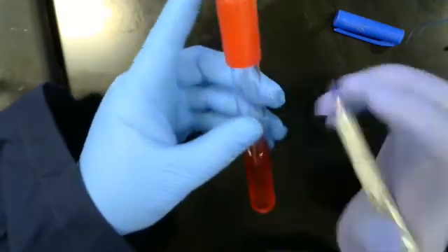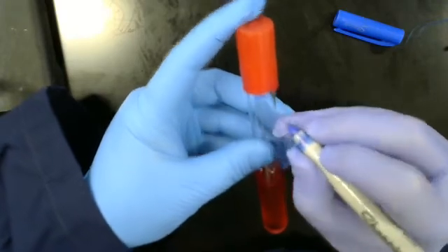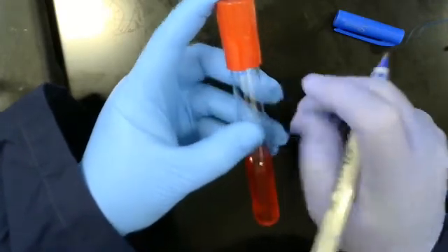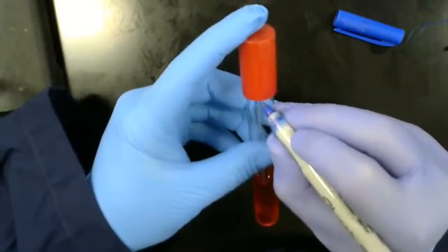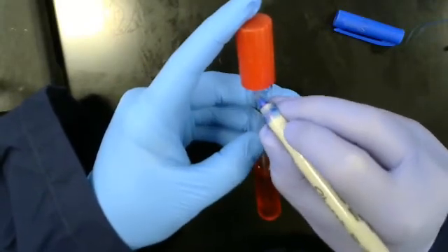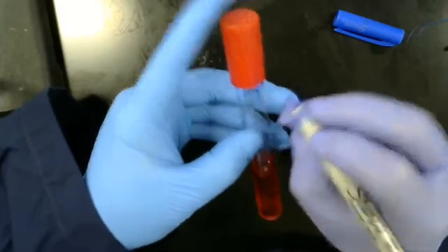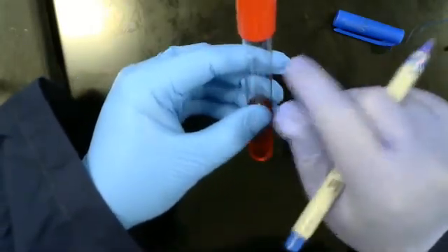Followed then by the media type. This is sucrose. So suc. Followed by your initial. And temperature. Again, just below the cap.